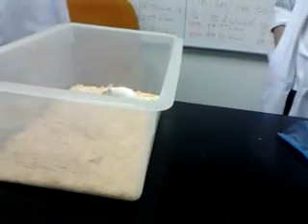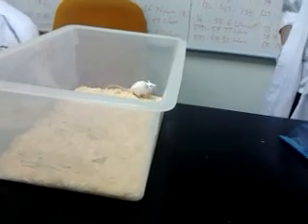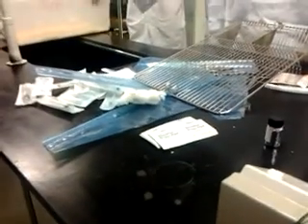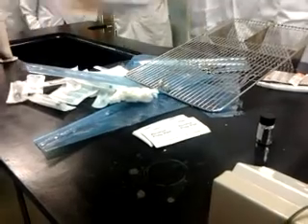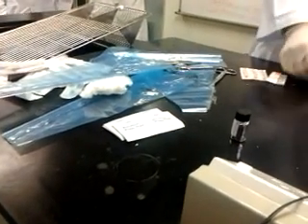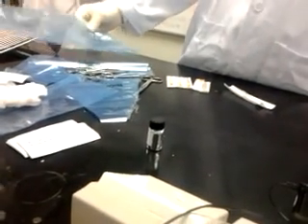Someone to weigh the animal, the mouse. Okay, so can you weigh the mouse? Weigh the mouse. What's the weight? And you have the red one, the restrainer. Red. Okay, I think I'll try this next one.